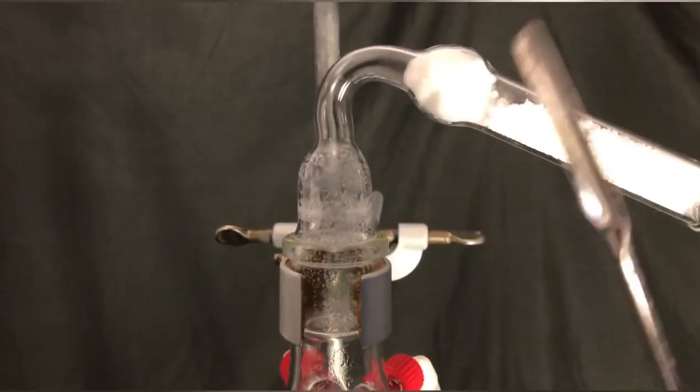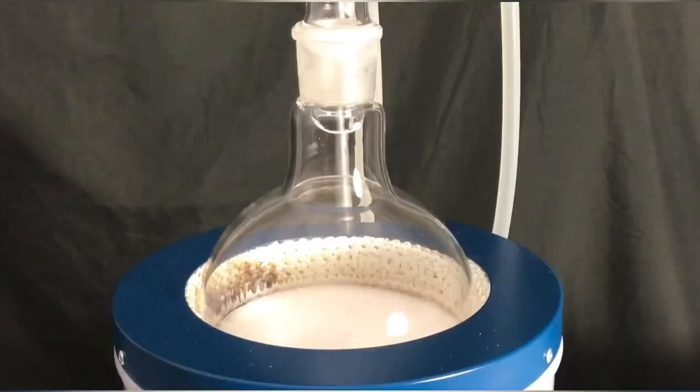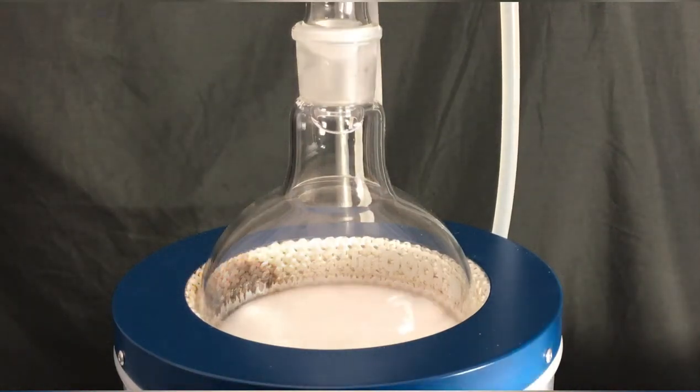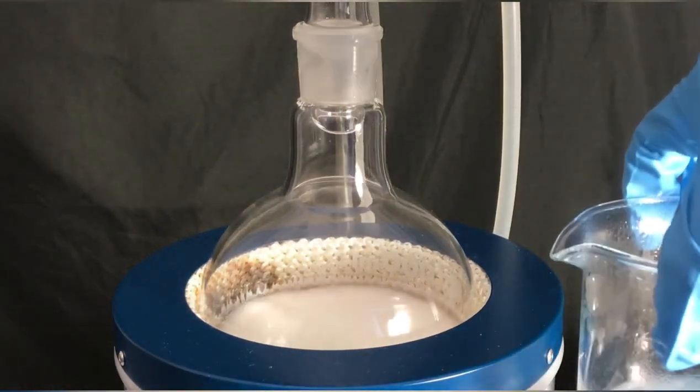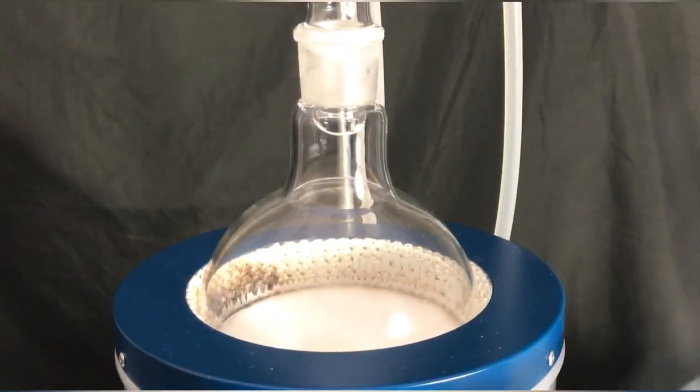What I found interesting was that after some time, some, what I guess was barbituric acid, had settled on the top and on the bottom of the condenser. It's strange that no solid had settled on the walls in the middle of the condenser, but only on the top and on the bottom.